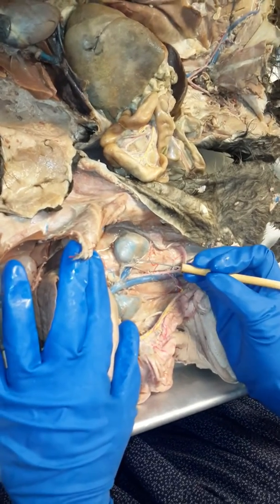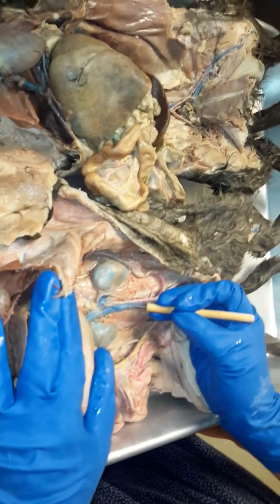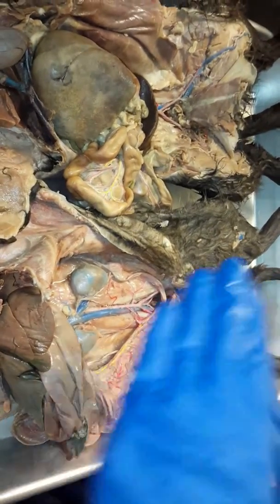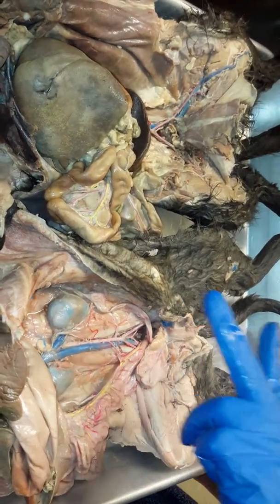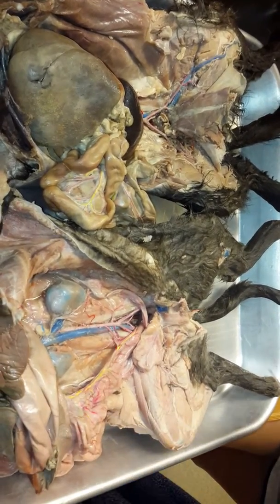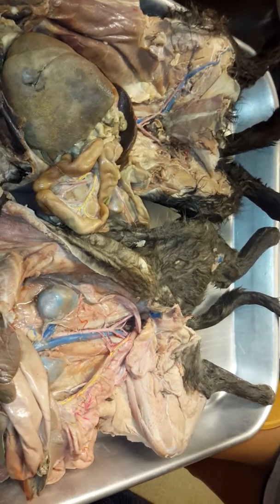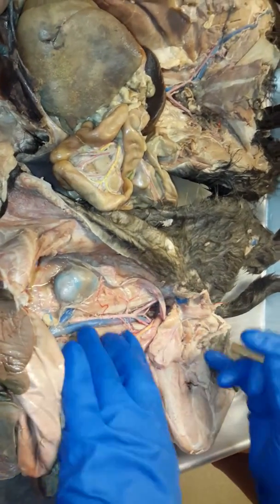So if it's headed to the kidney, it's going to be the renal vein, and then you tell me whether it's left or right, okay? So this is a renal vein following all the way down. This is where it gets kind of tricky, and actually the arteries kind of flip and go on top, which is weird. But what's going to happen is you're going to have these veins, and they're going to branch off into the iliacs, the iliac veins. They're called iliac because it pertains to the region of the pelvis. You remember how you have ilium, ischium, and pubis? That's where the iliac comes from, because it's around that portion of your pubic bones, okay?